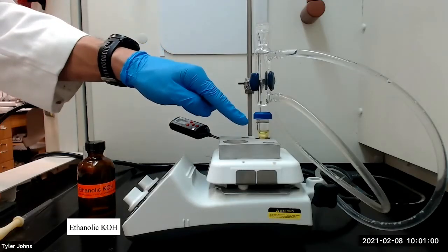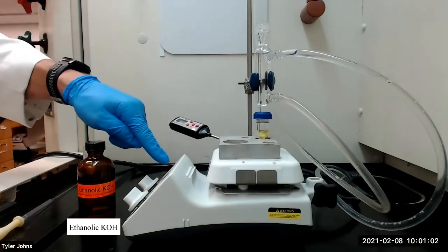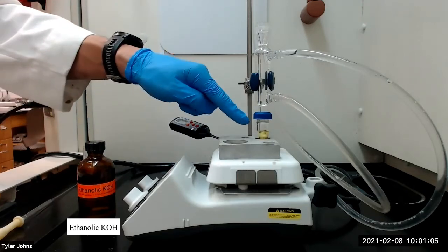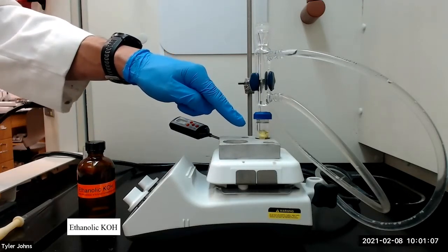Once the solids have completely dissolved, we will need to raise the temperature of the hot plate until the mixture is just below its boiling point.